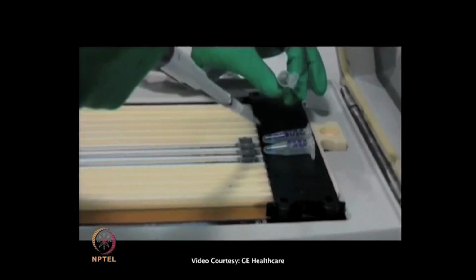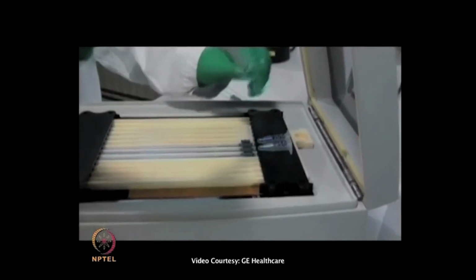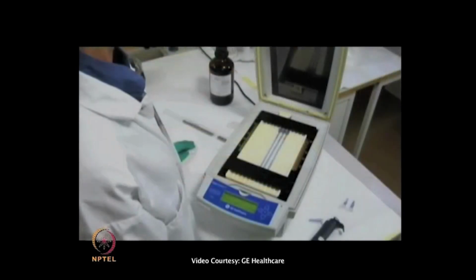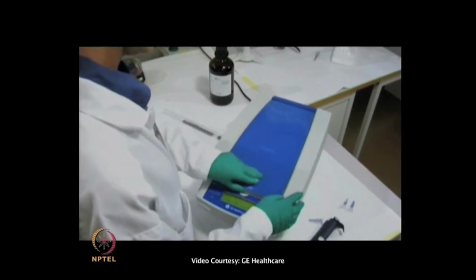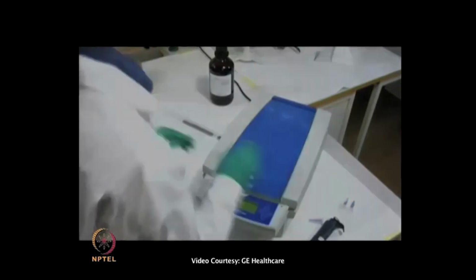We have either directly applied non-fractionated samples without prior fractionation, or fractionated the samples into membrane and cytosolic fractions before they were applied. The lid is closed to protect the fluorescent samples from light. The instrument was programmed according to recommendation and run overnight.